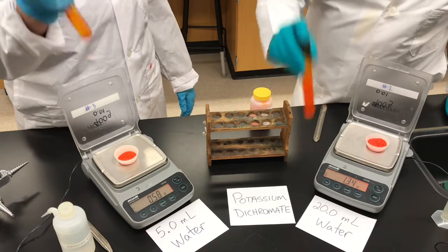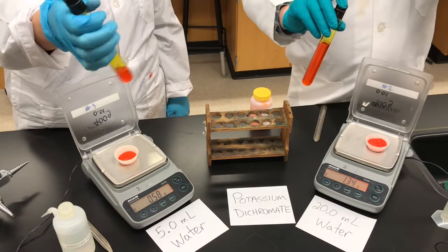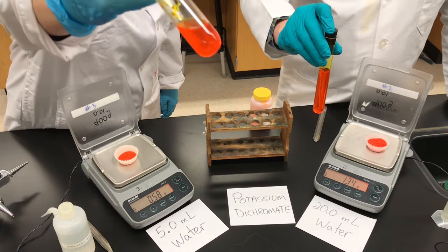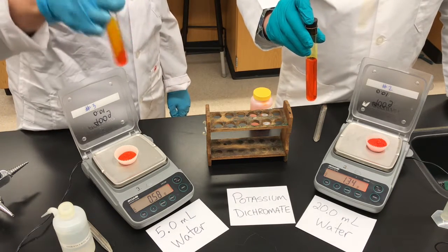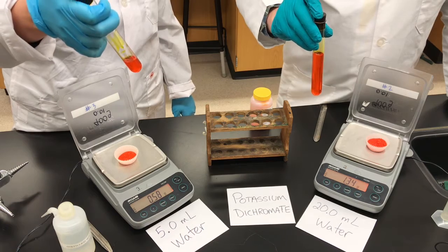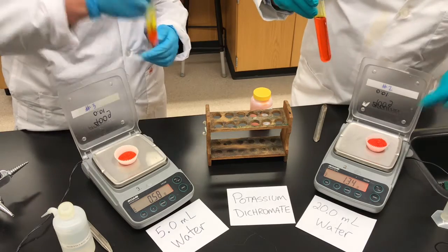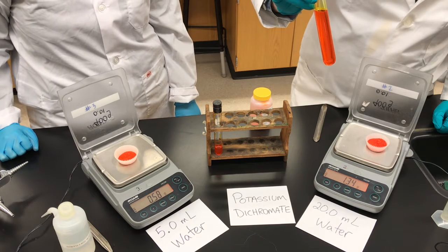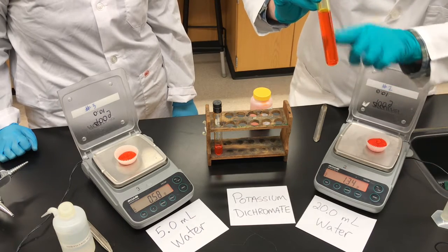We've been shaking for several minutes. I've now added about 0.5 grams of potassium dichromate to my test tube, and there's just a tiny little bit of crystal left at the bottom, so not quite all of it has dissolved — I'm fairly confident my solution is now saturated. I've added 1.34 grams and I have a lot more water — 20 milliliters versus her 5 milliliters — but even after 1.34 grams, all of my salt is dissolved. You'll notice the color of the solution is much darker now; with a colored solute, the more concentrated the solution, the darker it looks.